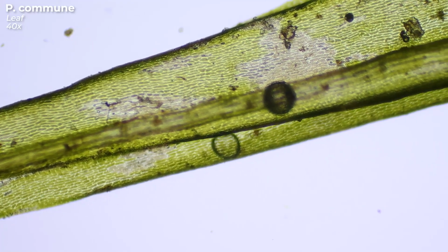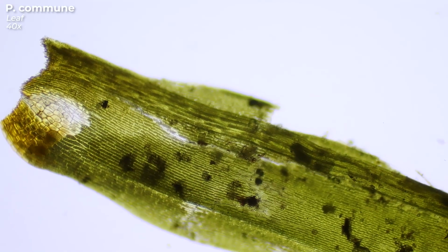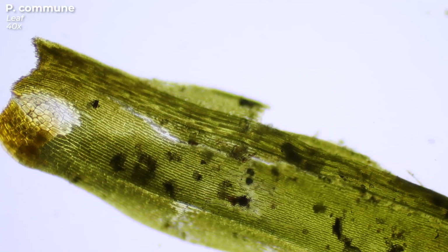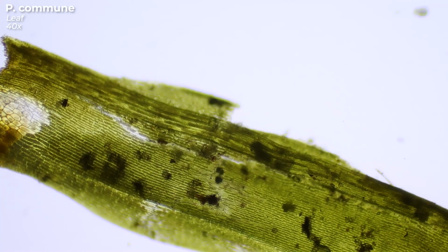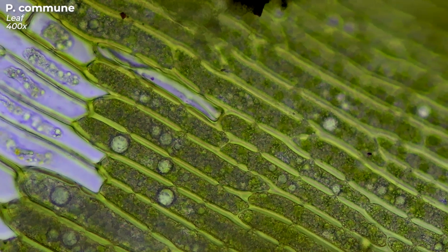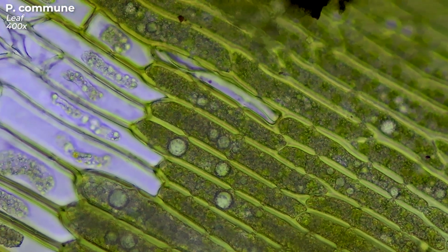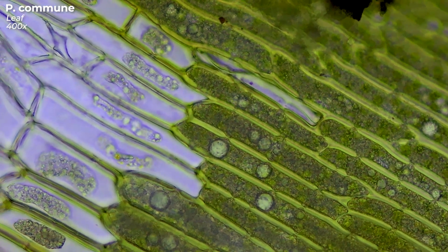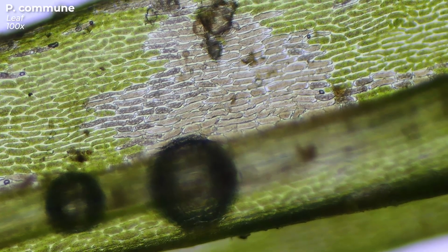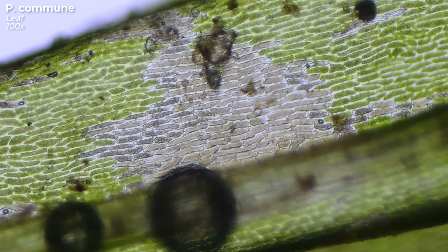Since the moss is very tough and durable, it was used in the Middle Ages to weave so-called moss braids, which could then be used as ropes, for example. The green cells also contain chloroplasts, which are essential for the process of photosynthesis. The more whitish cells lack this important green pigment, which can be seen here.